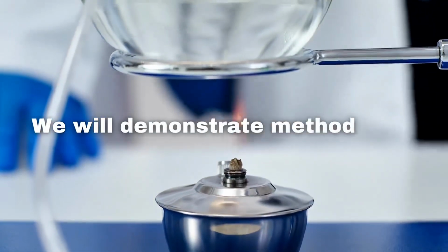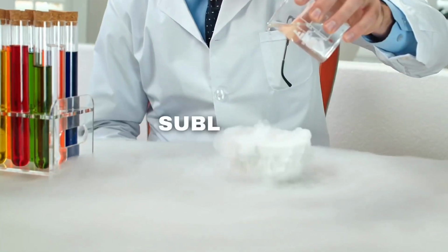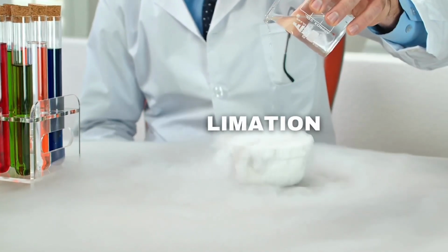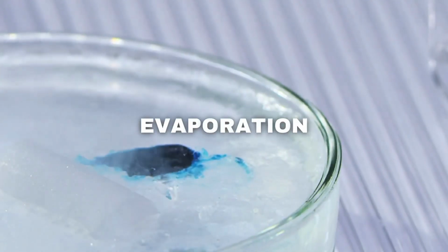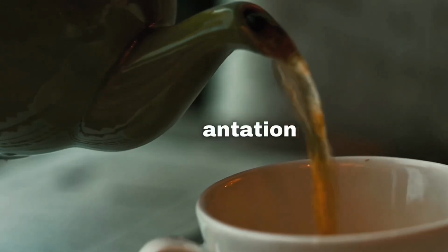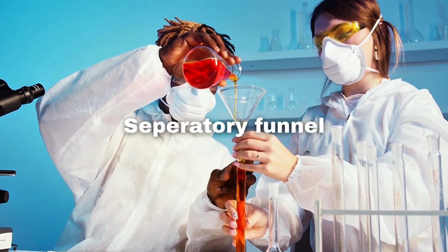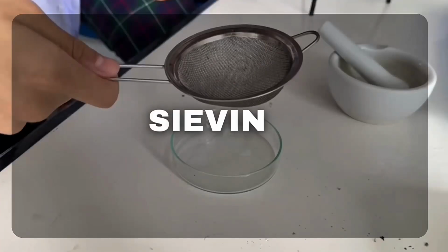We will demonstrate methods like sieving, sublimation, filtration, evaporation, decantation, separatory funnel, and chromatography. Sieving.